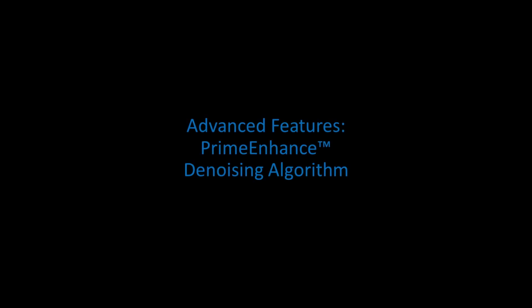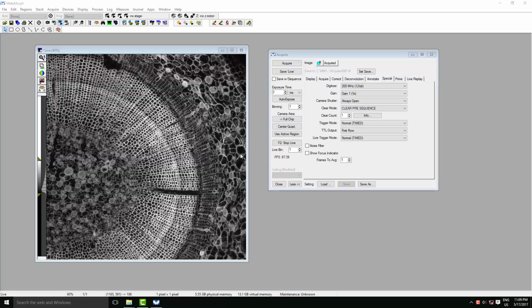Finally, we'll have a look at one of the advanced features of the Prime95B, and that's PrimeEnhance, our onboard denoising algorithm. If you're working at fairly low signal levels, or just generally have a fairly poor signal to noise, it will filter out some of the noise, preserving the intensity values of your signal, so you'll still get your peaks at the same values, but you'll just have less of the background noise. You can activate PrimeEnhance by ticking the noise filter option in the Special tab.